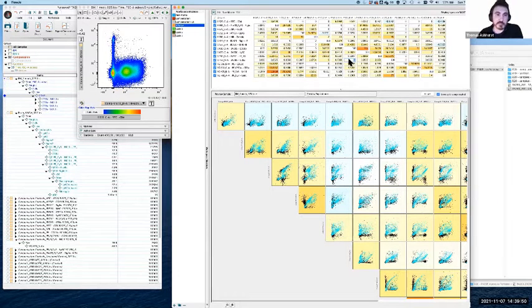If I turn this up much higher, it's going to push this population that's kind of going up and down. It's going to push it to the left. In terms of the value being applied, it's trying to remove it from the non-target detector, just like that. So that's clearly an example where the compensation has gone too far. It's been too excessively extracted from the non-target detector. Maybe I'll make it a tiny bit lower just to make it a bit more interpretable. So that's the classic curve that we're trying to look for. There's a couple of situations we'll come to where it's not always clear which is the offending fluorophore. It may not always be easy to interpret.